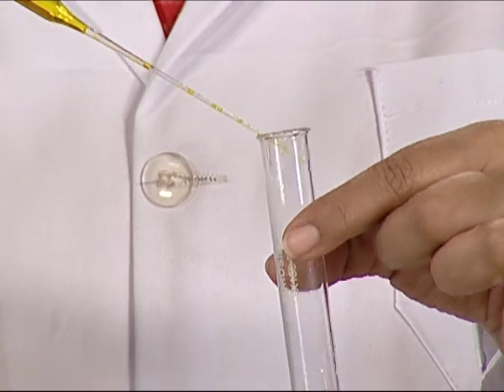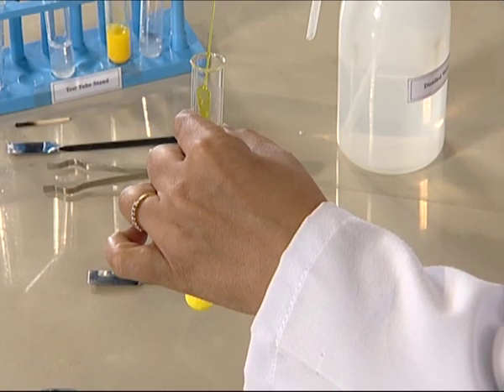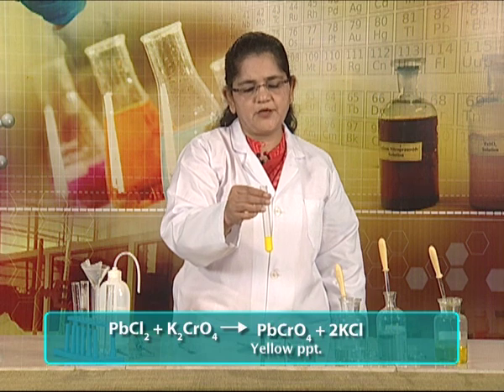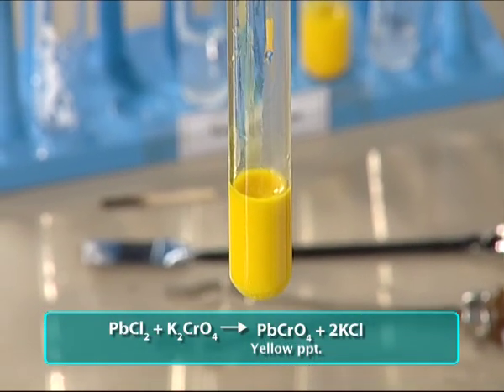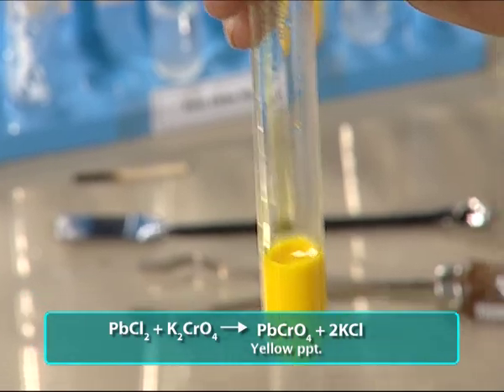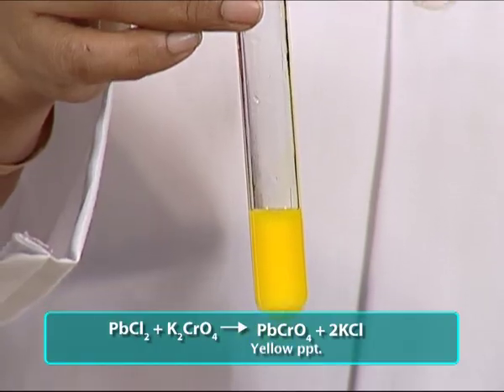Carefully notice the change. The formation of a yellow precipitate indicates the presence of lead. The yellow precipitate is of lead chromate.